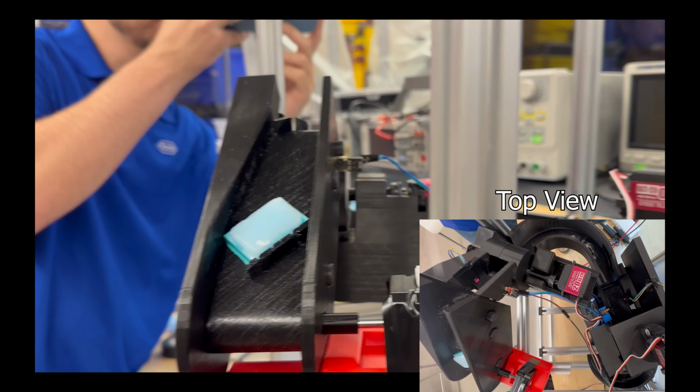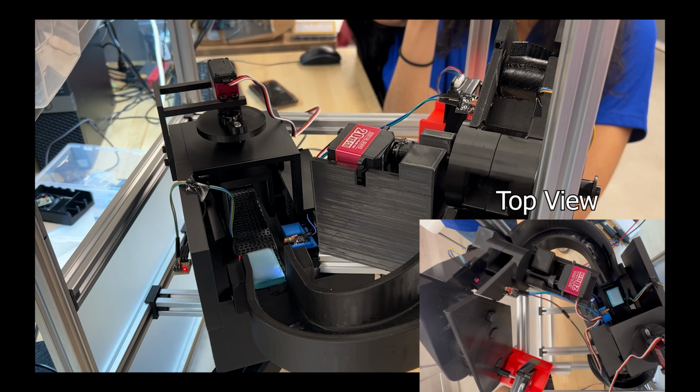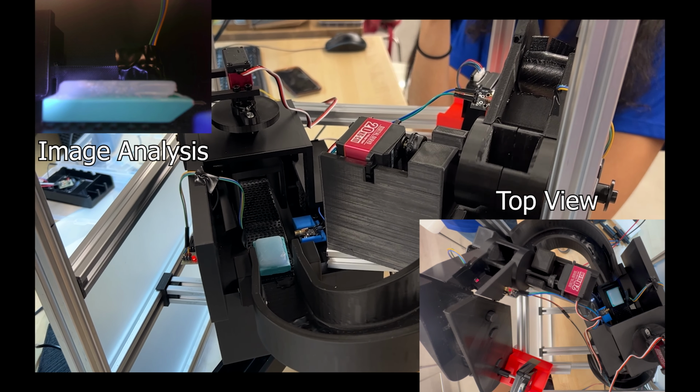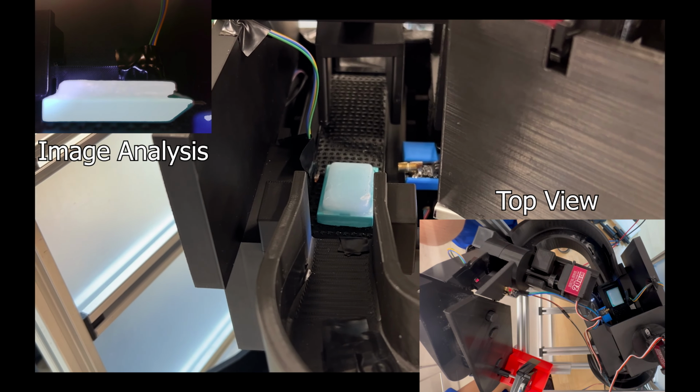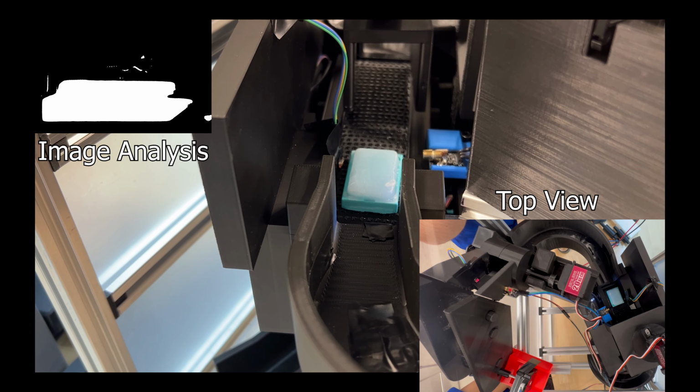This demo shows what happens if the block does not flip but needs to rotate. The block goes up the input conveyor, slides straight through the flipper, and stops at the camera. The system then goes through our algorithm. The image is converted to grayscale and then a binary black and white image. It then goes through 2 morphological operations to sharpen the binary image and then outline the white sections.